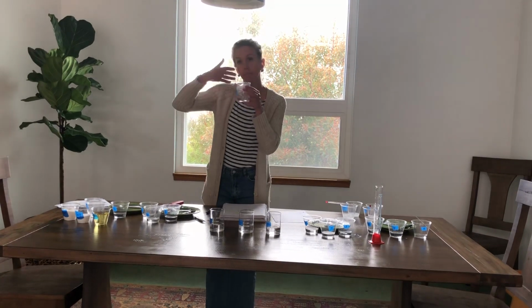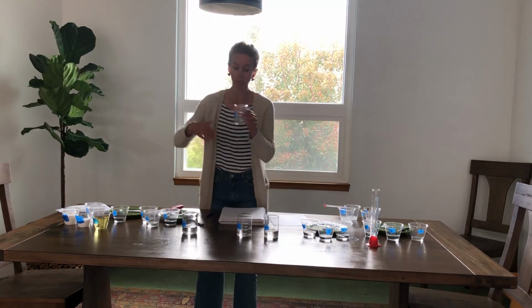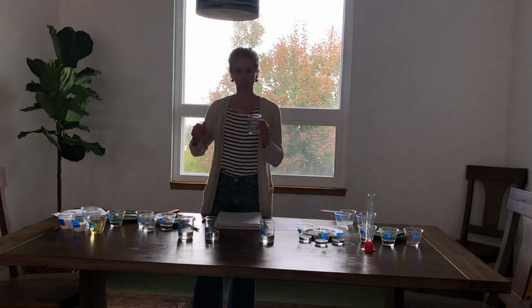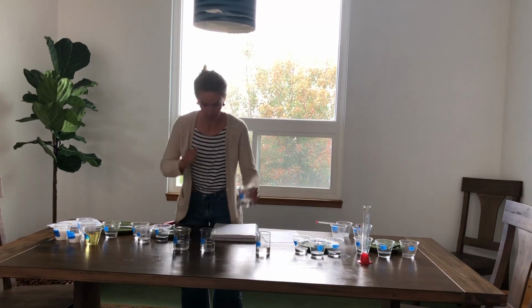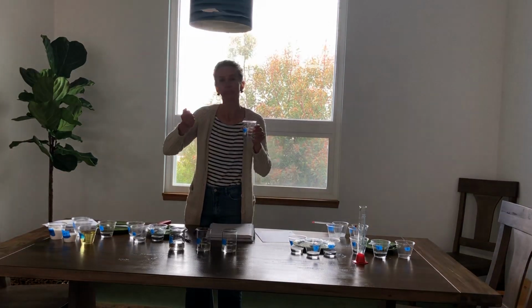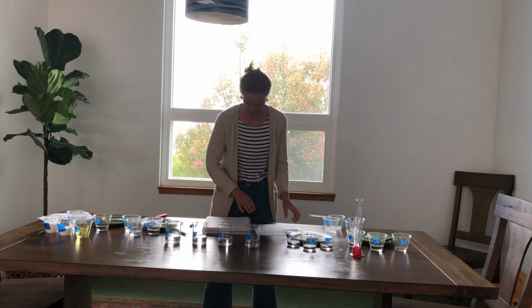So liquid 1, no odor. So write that down. Liquid 2, ooh, odor, yes. Write that. Number 3, yes, odor. You're gonna have to believe me. Number 4, no odor, okay? Let's move on to melting point.